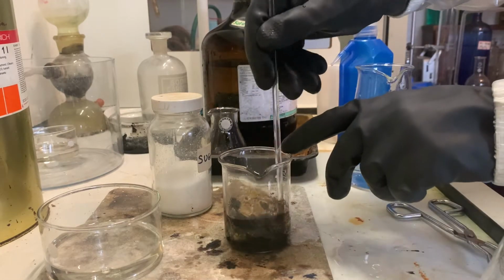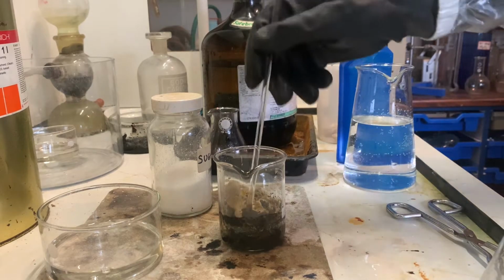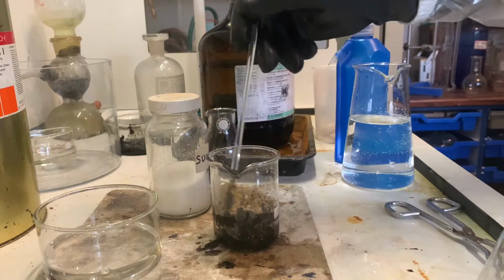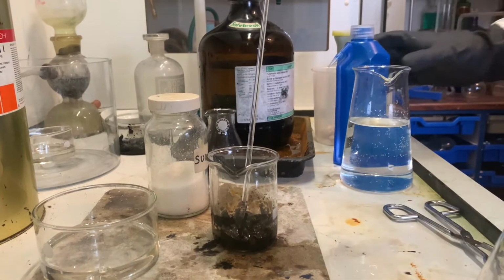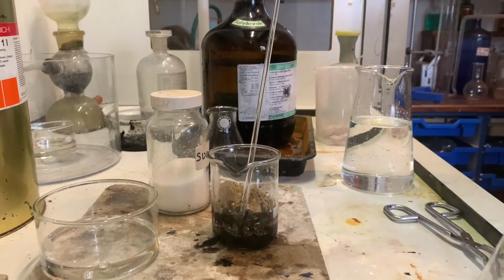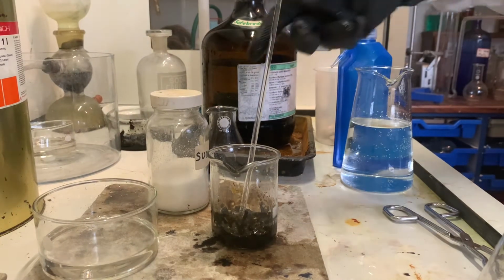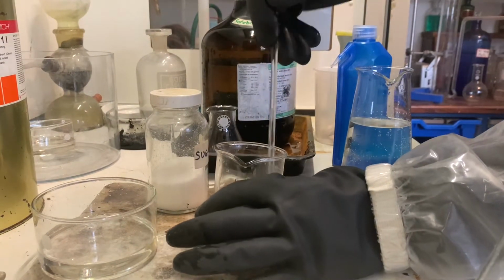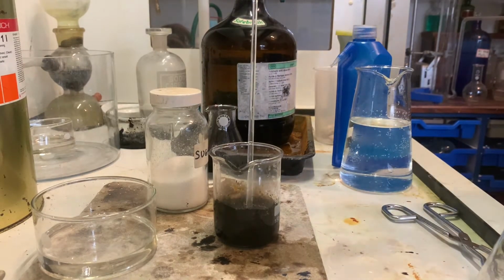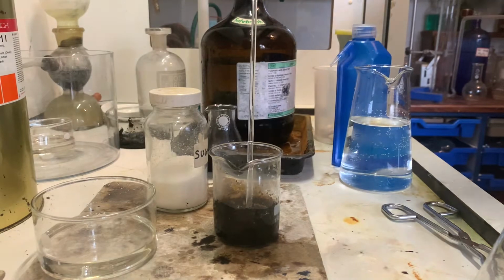You can see there, it has immediately carbonized the sugar. It's taken the water out of it in the form of oxygen and hydrogen. It's going to leave behind carbon. And whenever you add small amounts of water to acid, it can get up to about 120 degrees centigrade. And this actually will increase the rate of this reaction, because of course, whenever you heat substances up, the molecules get a bit more excited.